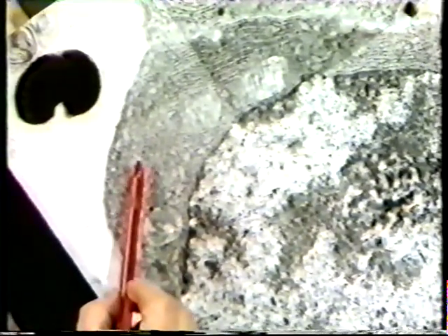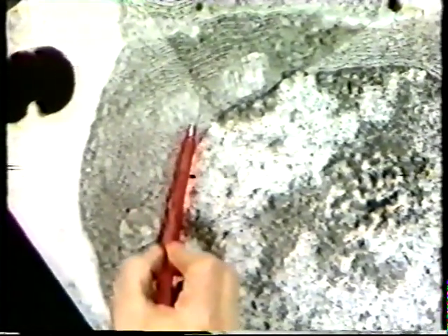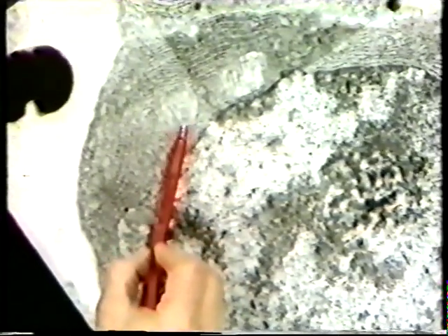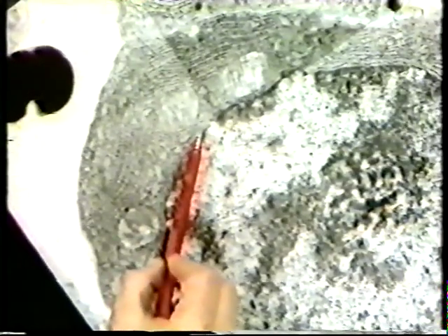If we go in and look at this at higher magnification, you can see a number of dark blobs along the surface. These are ribosomes, which indicates that this cell has got a considerable synthetic capacity. As we move up the cell, here is a mitochondrion, which has a number of transverse cristae. And here is the nuclear envelope.